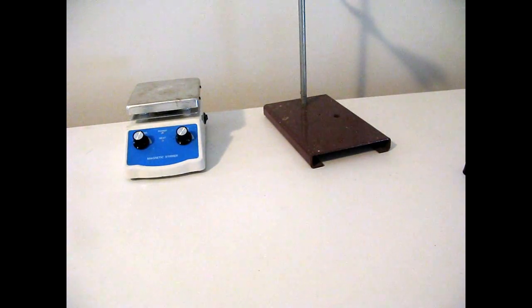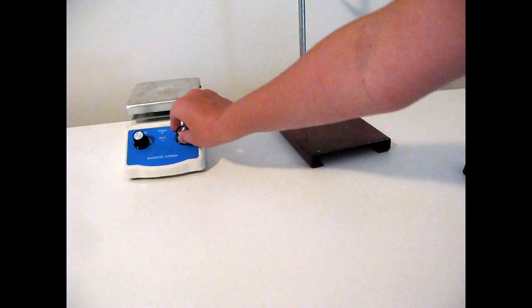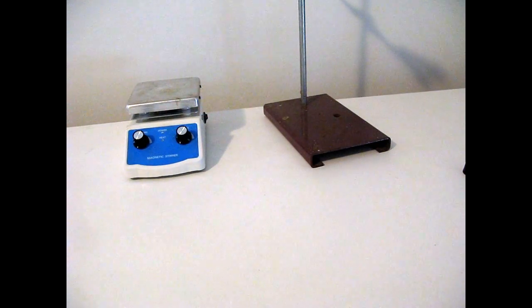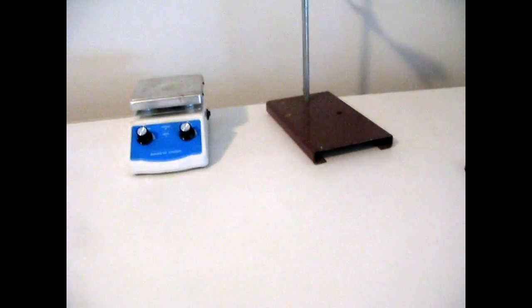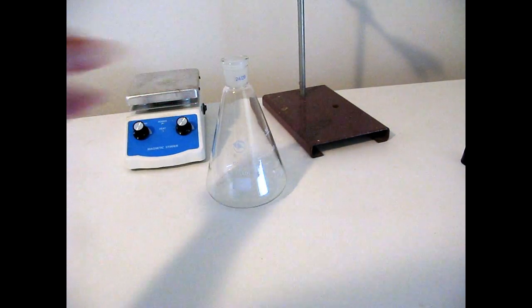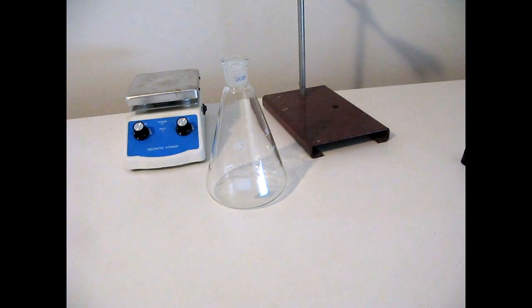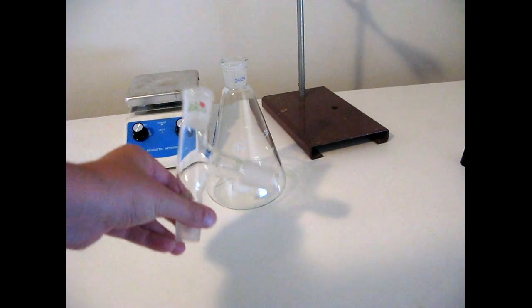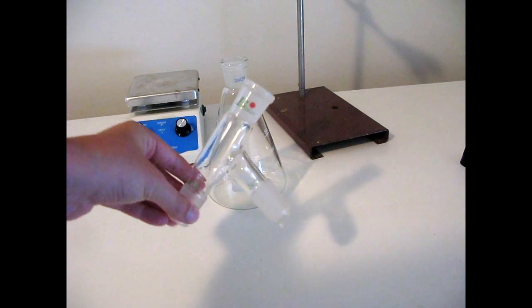To set up a distillation apparatus, you'll need some source of heat, a clamp that I have here, then you'll need also a flask of some sort that you can hold the reaction in, a 75 degree turn. The third part is optional.